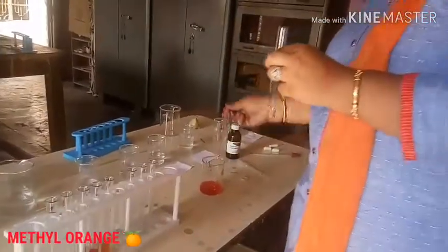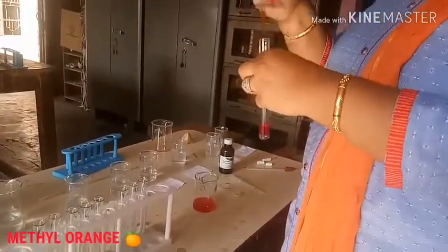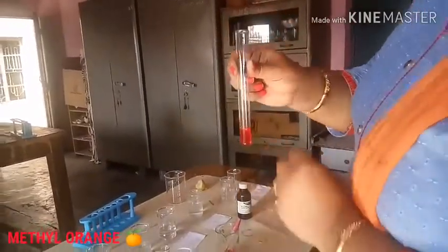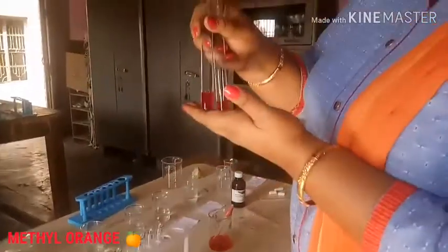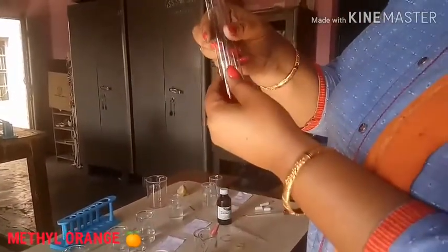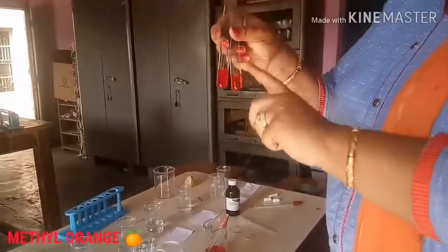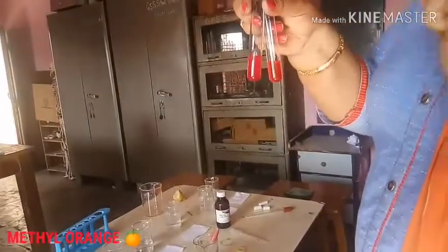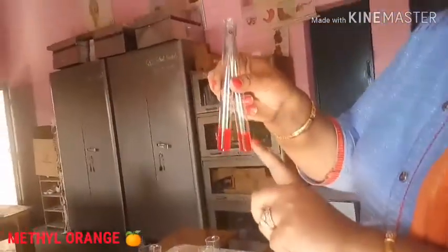The sixth sample is acetic acid. It is a weak acid. Acetic acid also gives red color with Methyl Orange. But comparing hydrochloric acid and acetic acid, you can see a crystal clear difference. Hydrochloric acid gives deep red, showing it is a strong acid. Acetic acid gives a lighter red color, showing it is a weak acid. The intensity of red color indicates the strength of the acid.